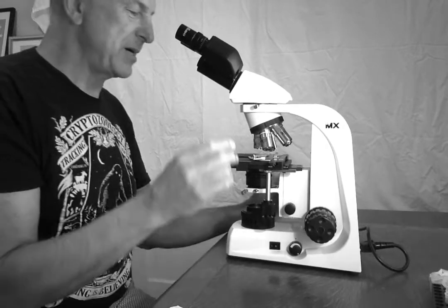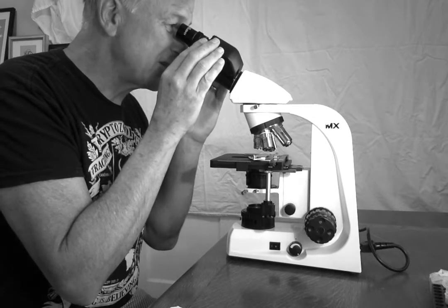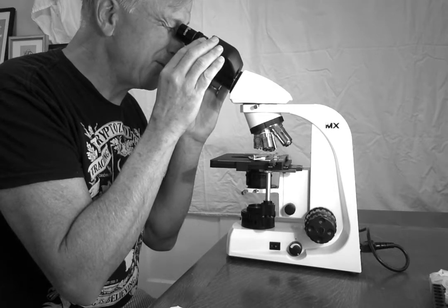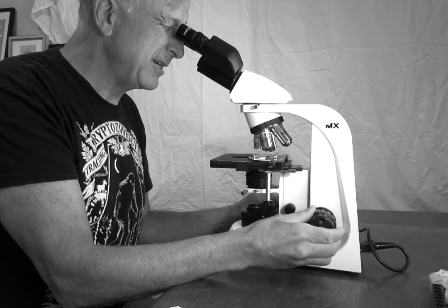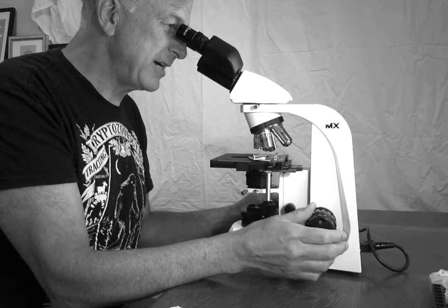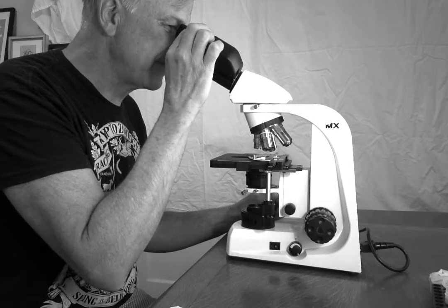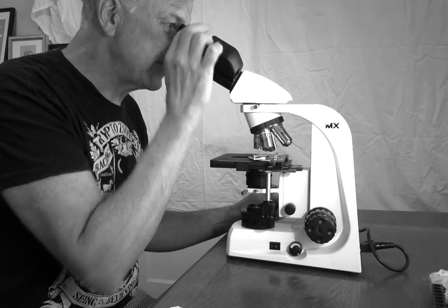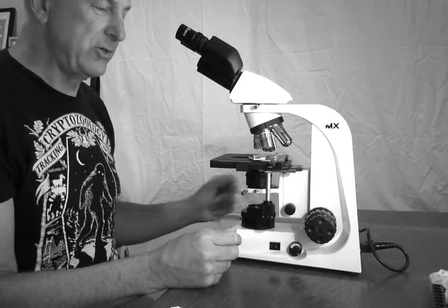So what I'm going to do is go back to my sample, which looked like it was in focus. I'm going to adjust this so I really only see one image. I'm going to close my right eye and focus for my left eye. Looks very sharp. I'm going to switch to my right eye, which looks a little fuzzy, so I'm going to adjust this knob on the ocular till that eye's in focus. Now I'm going to open both eyes and say, looks pretty good. I'm in focus. I can go back to Koehler illumination.